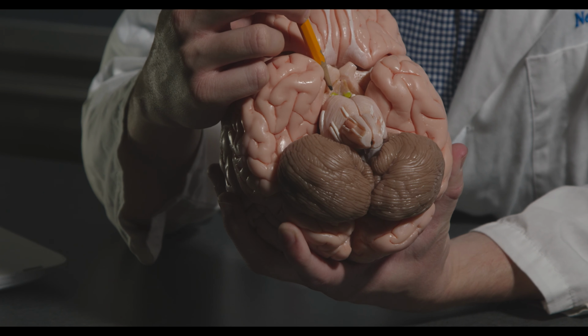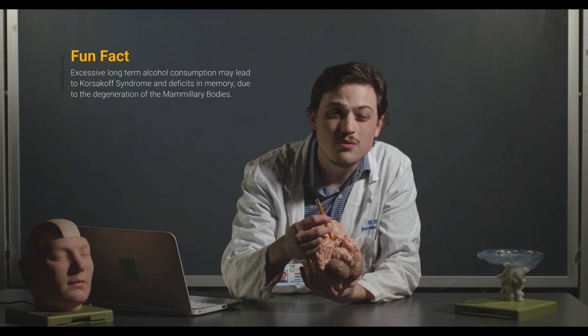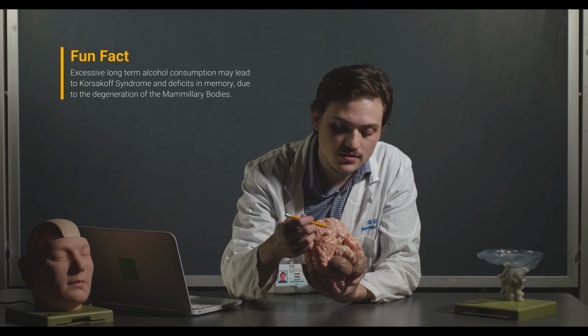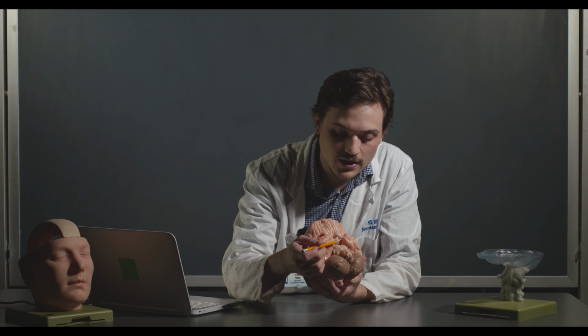Just posterior to that, you can see the mammillary bodies. It's kind of hard to see on this model. There's these little green bumps in here. Mammillary bodies are really important for learning and memory. Some of the fibers that are coming from the fornix come down to the mammillary bodies, and then from there they go to the anterior nucleus of the thalamus. Another thing that we'll talk about in subsequent lectures.